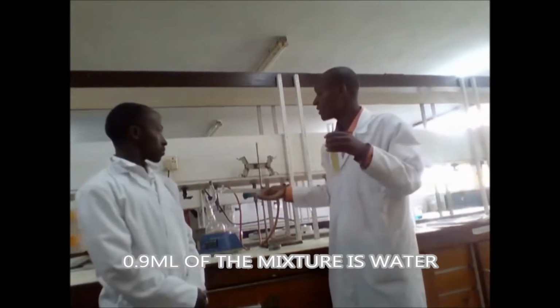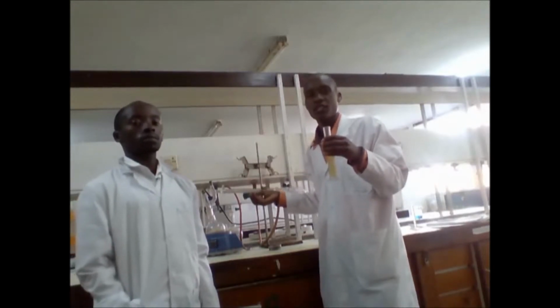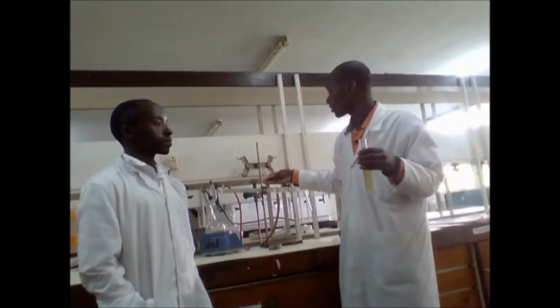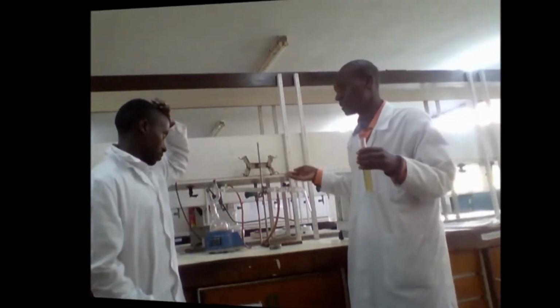But then we have the advantages of using the distillation method as one of the methods of determining the moisture content of food. One of them is that this method is used for those foods which have low moisture content. Two, the method is also simple. The apparatus can simply be set up.